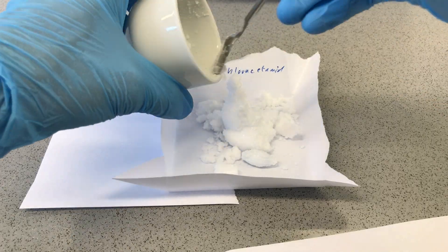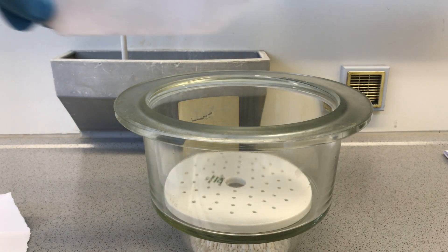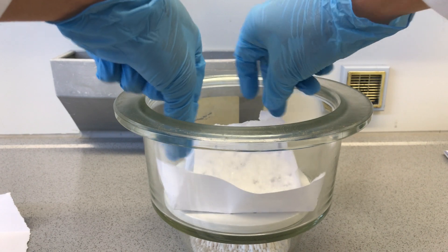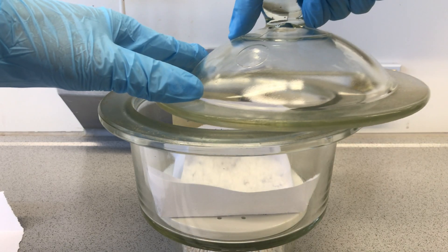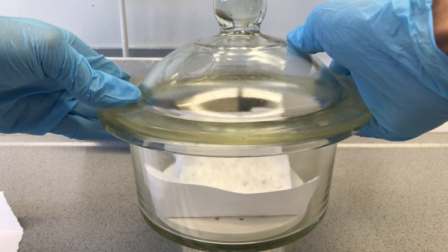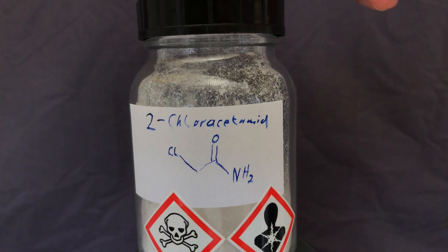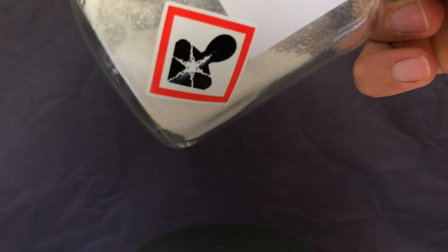Now there is only one thing left to do. We scraped it onto a piece of paper and put it into a desiccator of anhydrous calcium chloride. After drying, we were left with about 25g of chloroacetamide. This represents a yield of about 41%, which is absolutely horrible, and this means that I will have to repeat this preparation some day in the future.